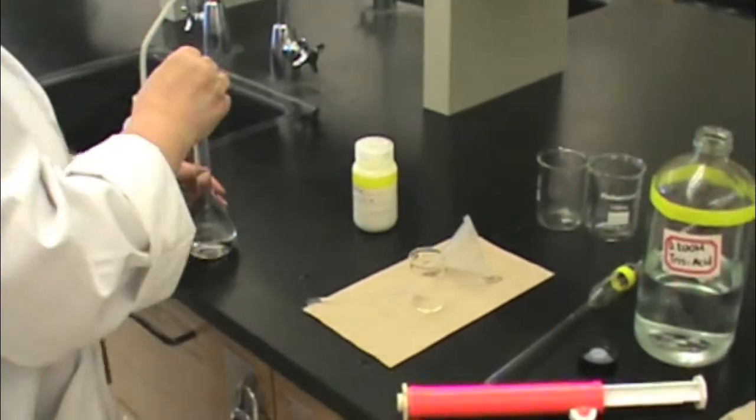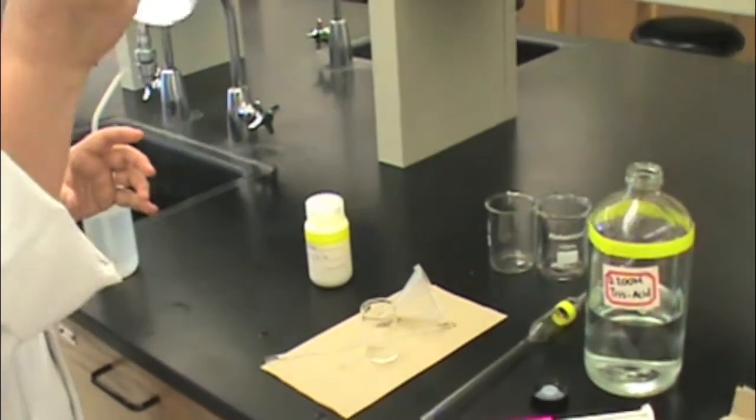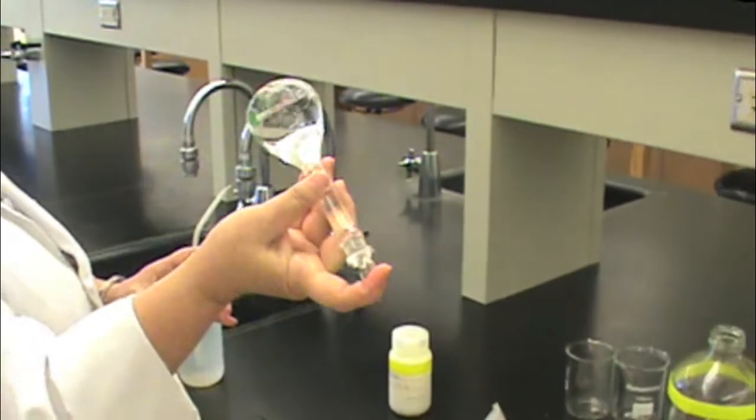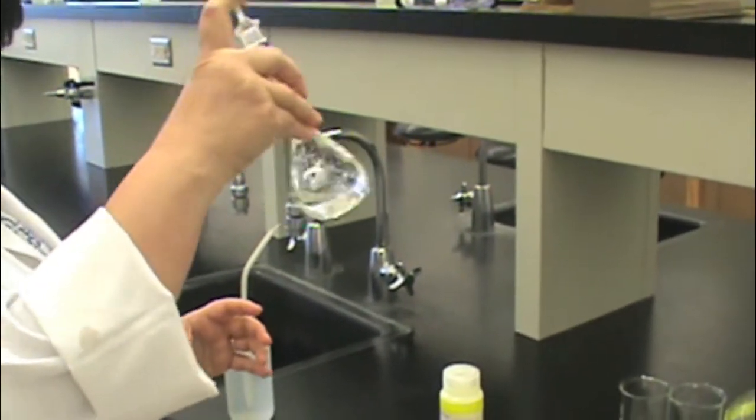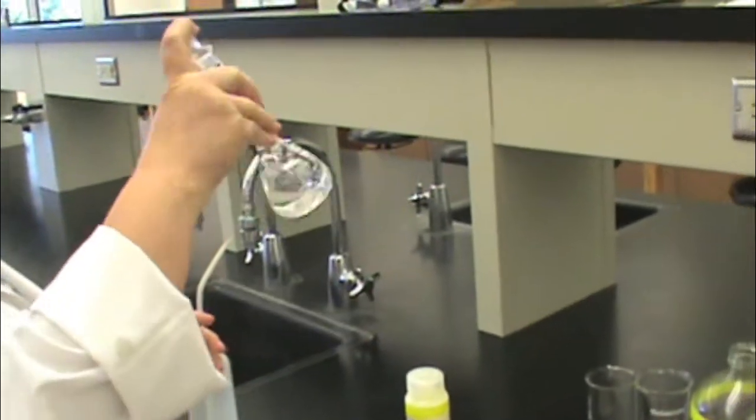Then cap your volumetric flask and invert to mix your solution well. Do this at least three times to make sure your solution is well mixed.